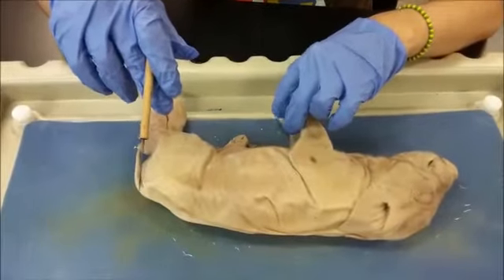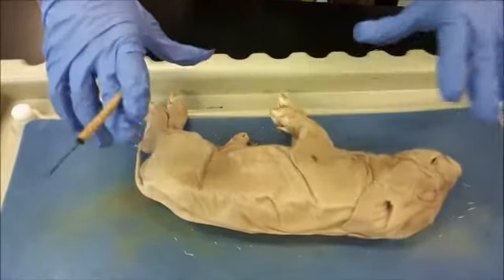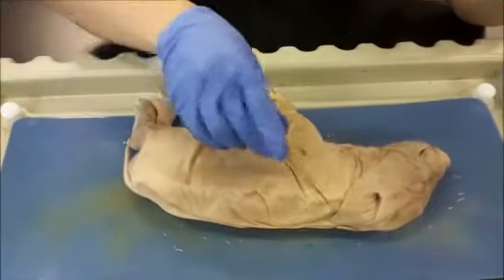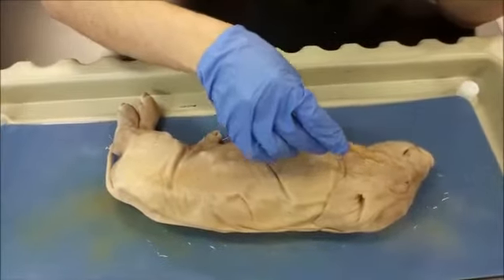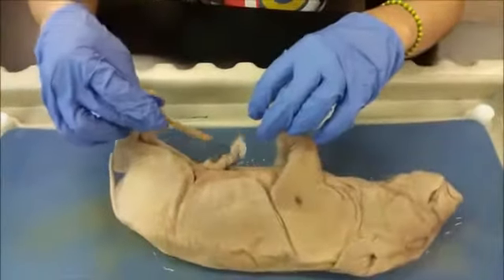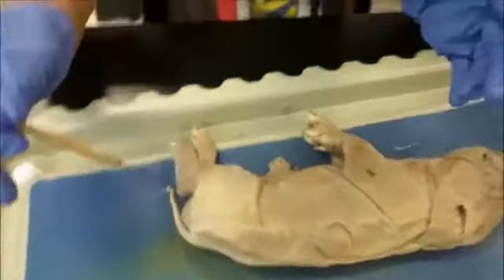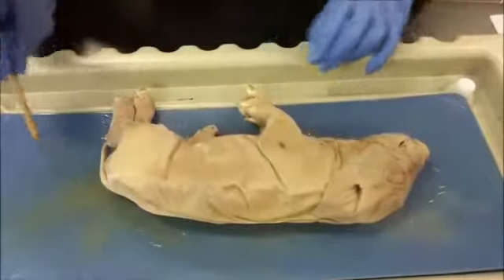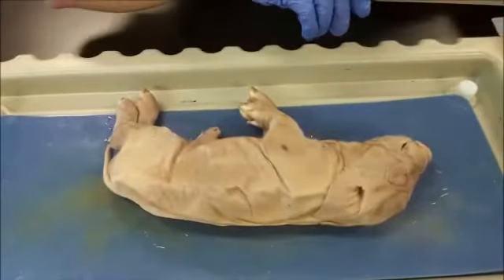This is Biology 2 majors with Professor Scher, and we'll be dissecting a fetal pig. Currently we're looking at the external structures, which would be the ears, the eyes, the mouth, the nose, the limbs, and the umbilical cord. You can tell it's a male because back here you can see the scrotum, and further up is the urogenital opening. Okay, I'm just cutting it open now.